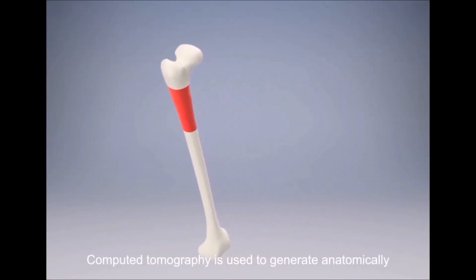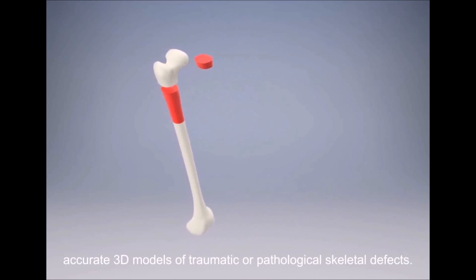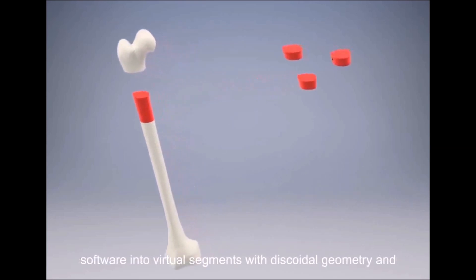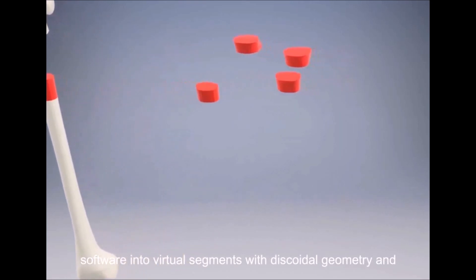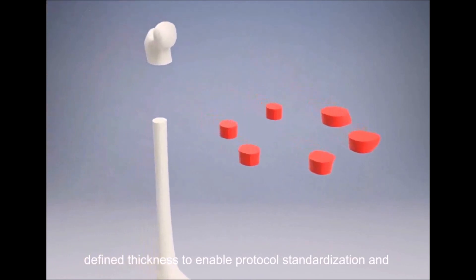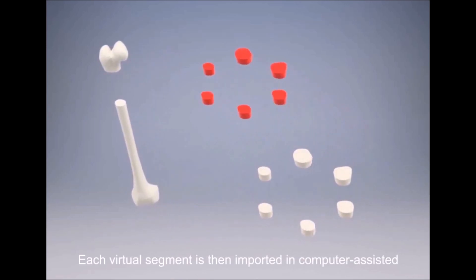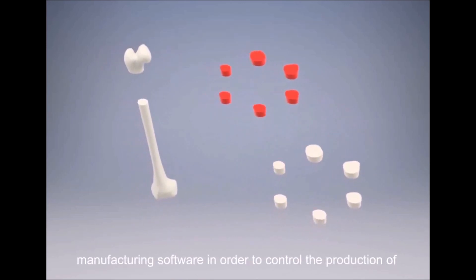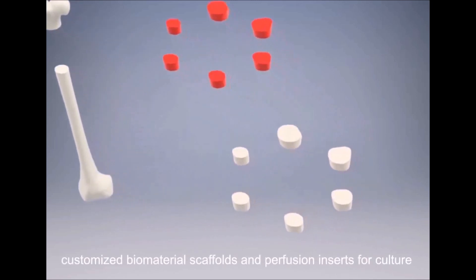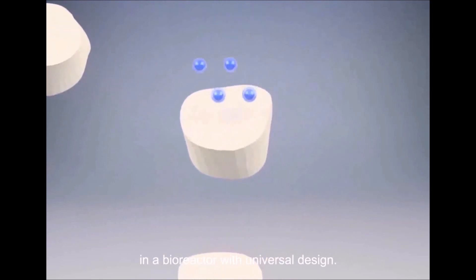Computed tomography is used to generate anatomically accurate 3D models of traumatic or pathological skeletal defects. These models are then partitioned using computer-aided design software into virtual segments with discoidal geometry and defined thickness to enable protocol standardization and effective tissue formation in vitro. Each virtual segment is then imported into computer-assisted manufacturing software to control the production of customized biomaterial scaffolds and perfusion inserts for culture in a bioreactor with universal design.